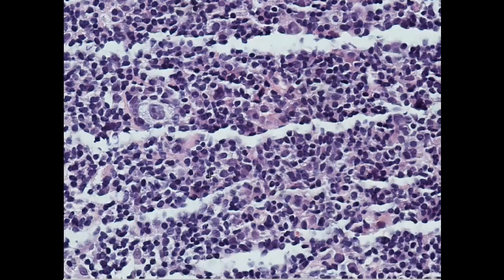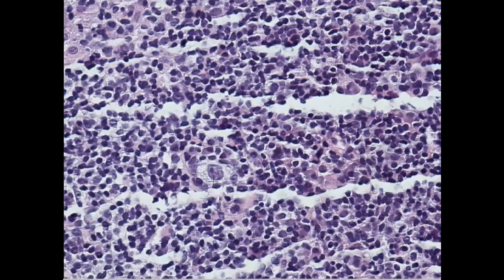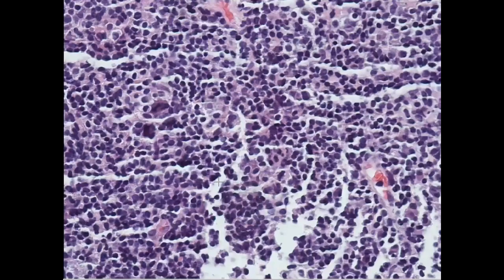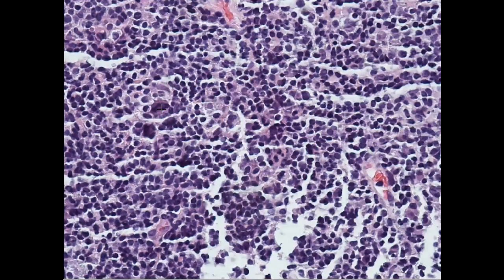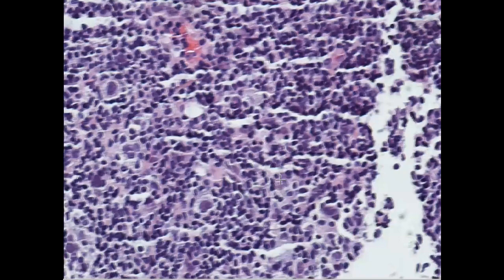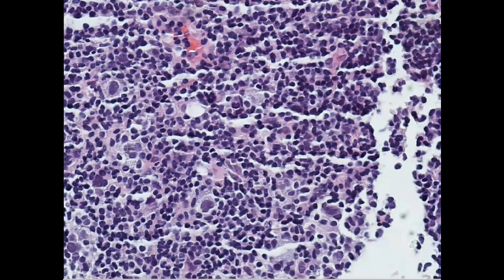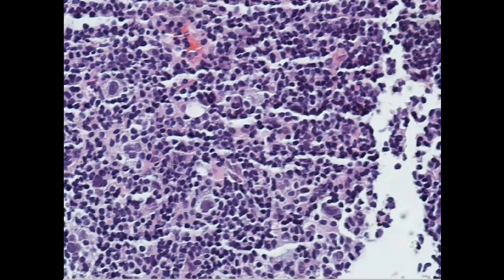Let's look for more of these cells. Here is another popcorn cell or LP cell. These are the mummified bodies explained in the previous video — a form of the LP cells or Hodgkin cells. We have here many other LP cells with the same features and cytoplasm. So now we suspect Hodgkin lymphoma and need stains to confirm the type.